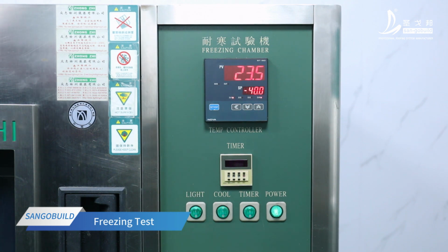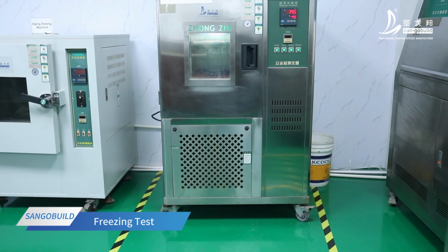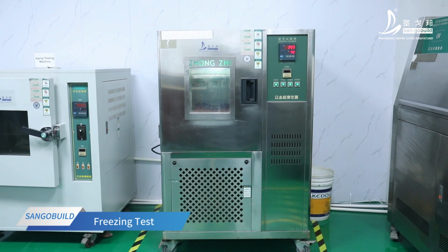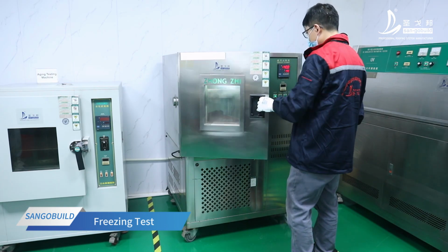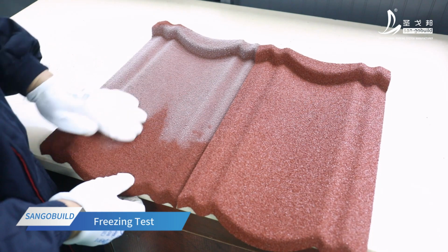After a period of testing, the laboratory technician compares the sample with the untested sample. Frost and ice appear on the surface, but there is no stone granules loss and embrittlement. Pass the test of freezing.